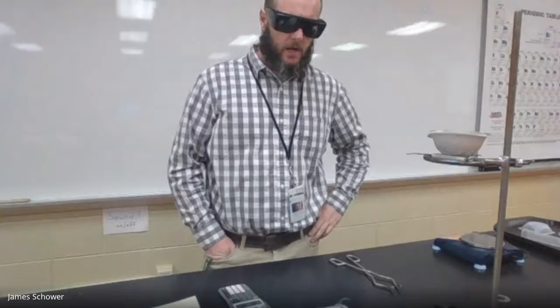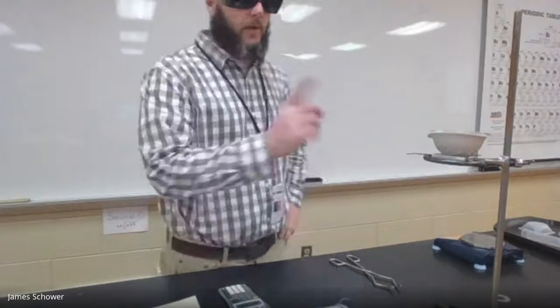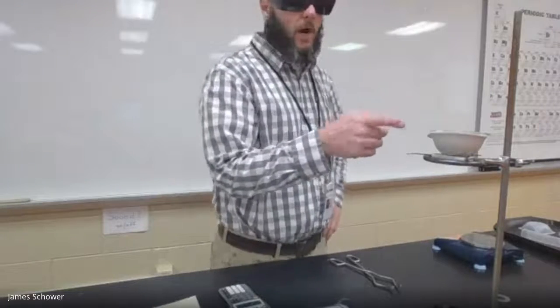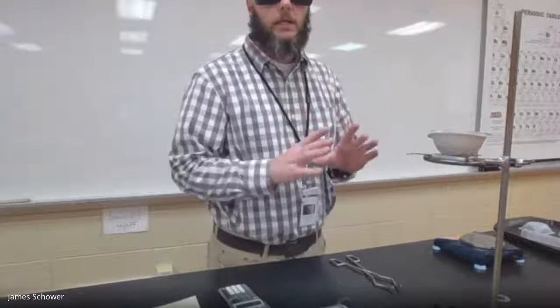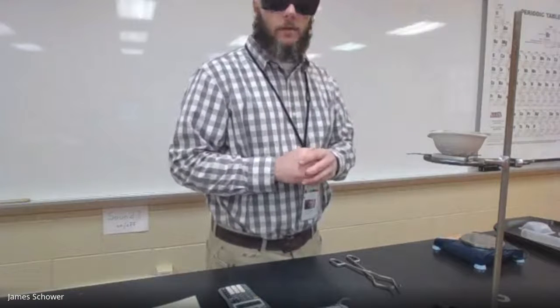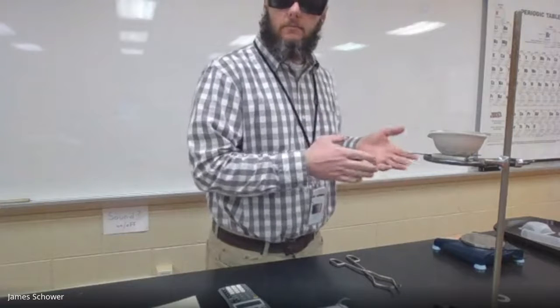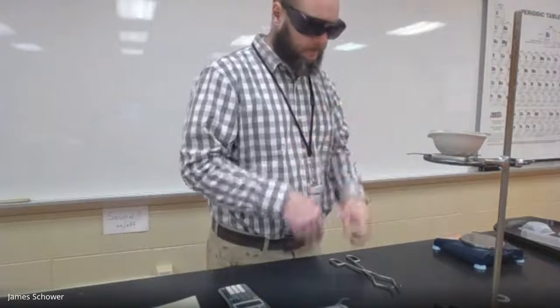All right, guys, this is the last part to Mr. Shower's Stoichiometry and Baking Soda lab. Here we have the evaporating dish and watch glass, which has been completely cool. I had a fan blowing on it, okay? So I wanted to make sure that before we weigh it, it's cool, okay?